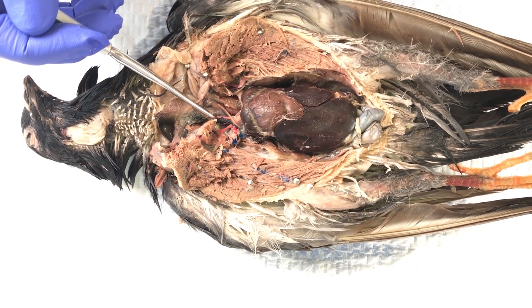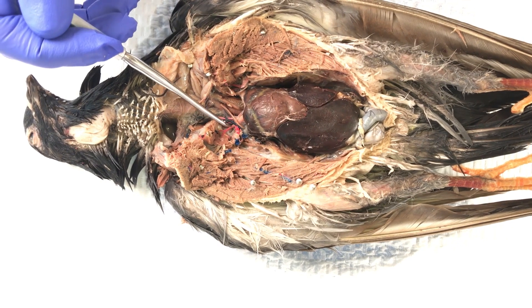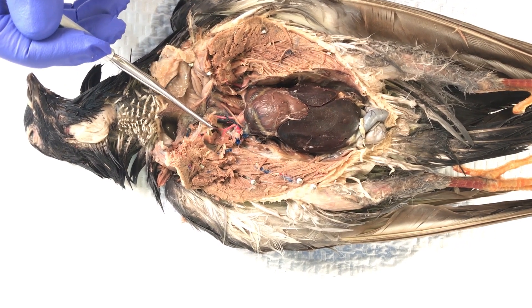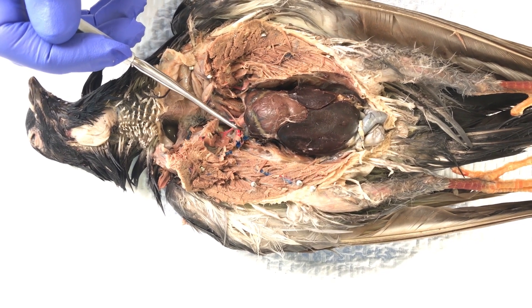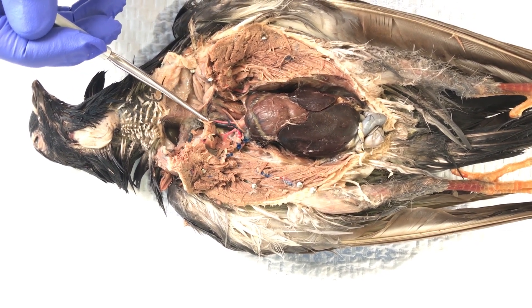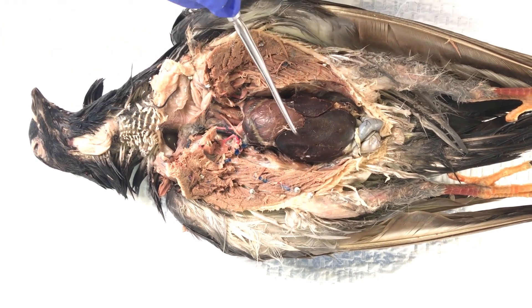We have the carotid artery, the axillary artery, and the pectoral artery. The jugular vein is also present and visible in blue.